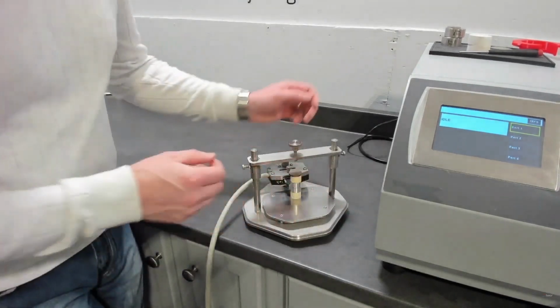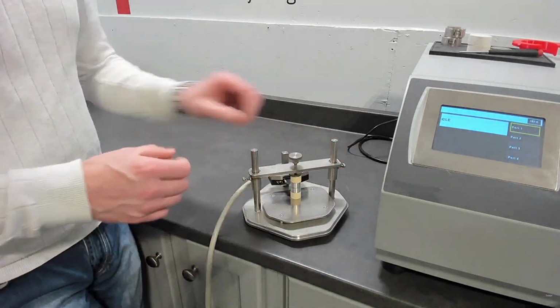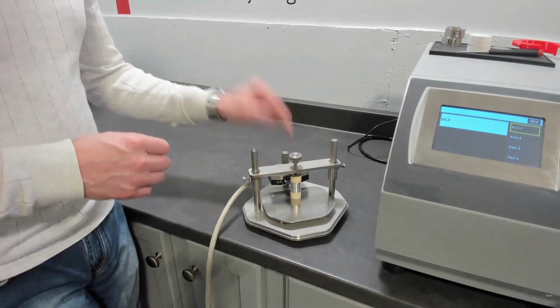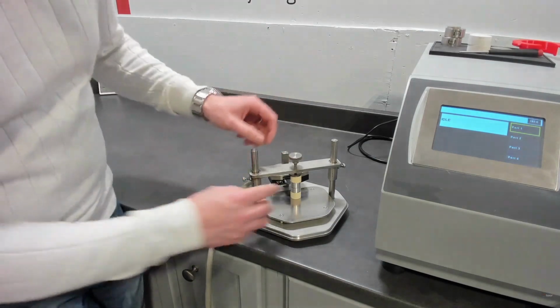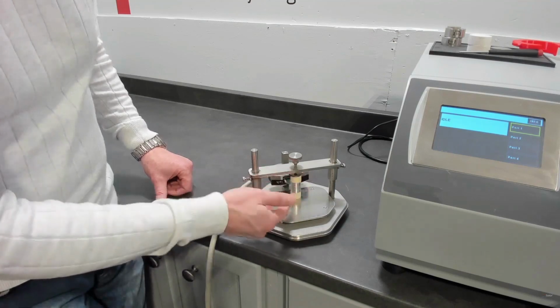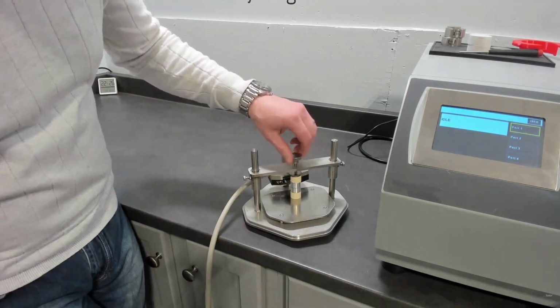And completing my thought on the sensors, we have a range of sensors with no extra Kapton that are precisely the diameter of the double spiral that's encapsulated. So this is a 20 millimeter diameter sensor, and with no extra Kapton, you can line up the stack directly to the spiral. So you have no heat loss with extra Kapton. Everything is a one-dimensional shape. So that's a symmetric setup.